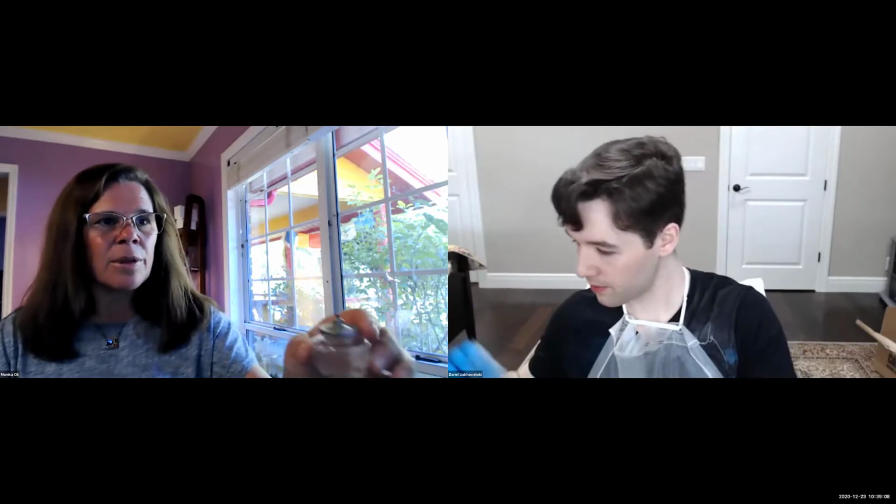Okay. Perfect. So you take the lid off, and then sometimes you may want to tip it over a little bit just so that the wick gets wet. So tilt it over so that the wick gets wet, and then it lights a little bit more easily. Okay. I just want to put a bag, like you said, over this container. And you said the bag's from the PPE kit or from another? Any empty plastic bag will do, just to put it in there so that you can just take it out and then dispose of it.